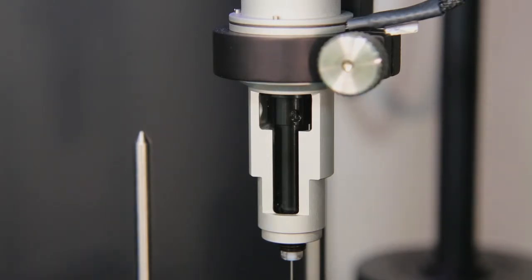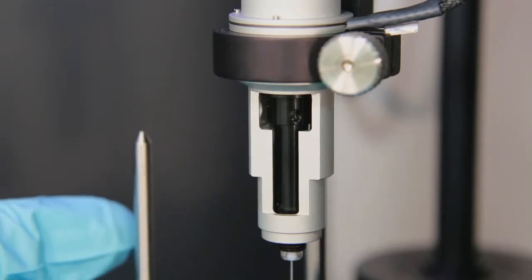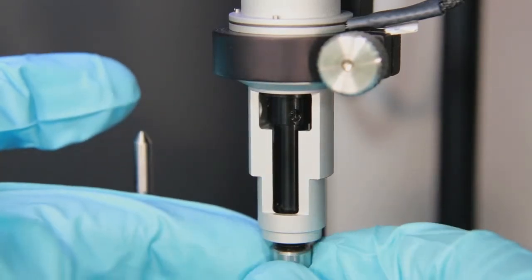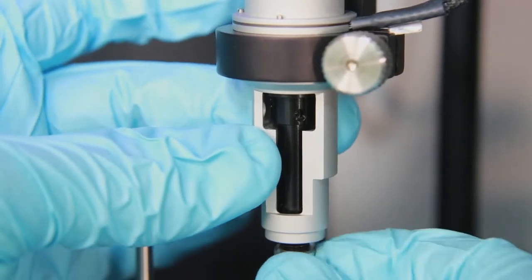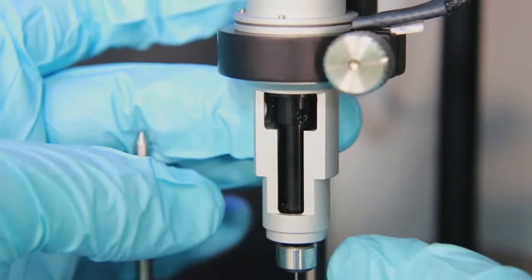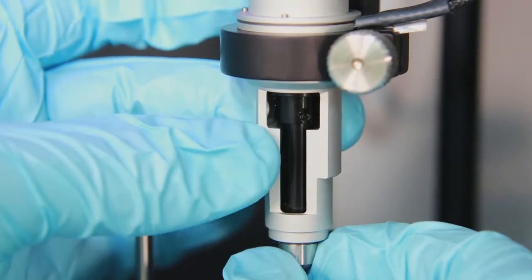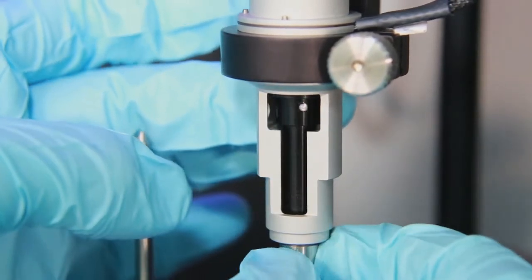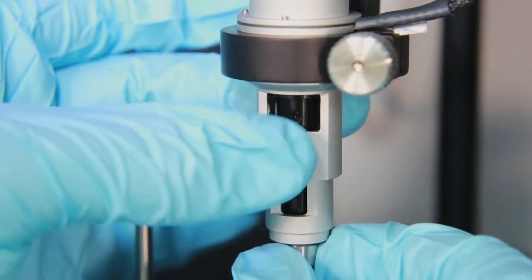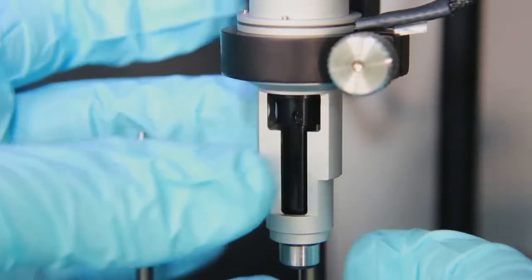The last step for installing a syringe is to gently slide the securing nut over the syringe paddle and gently finger tighten the nut onto the pipette. The pipette will spin, so gently grasp the pipette body to give it that final tighten.